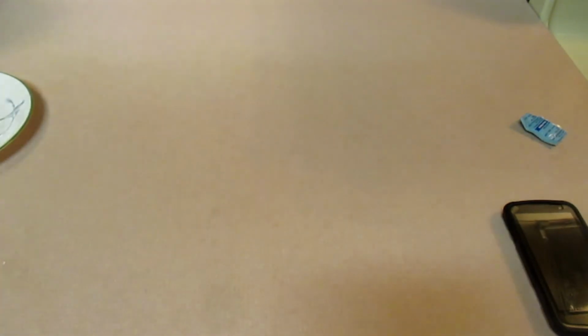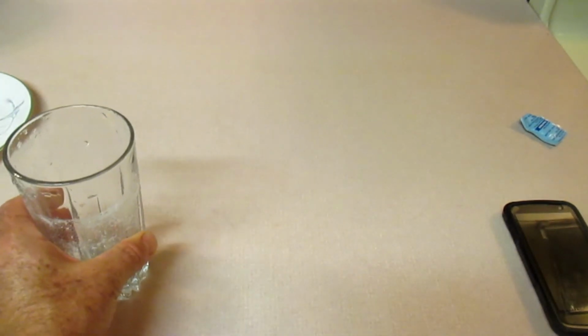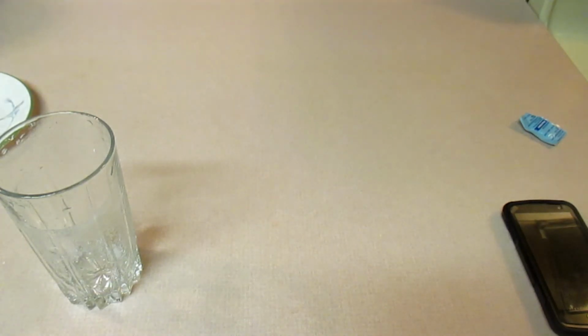Now you can dump this once again down the drain, and then what you'll turn in is your data tables and any of the post-lab questions I have. I hope you have a good day, and if you have any questions, please let me know.